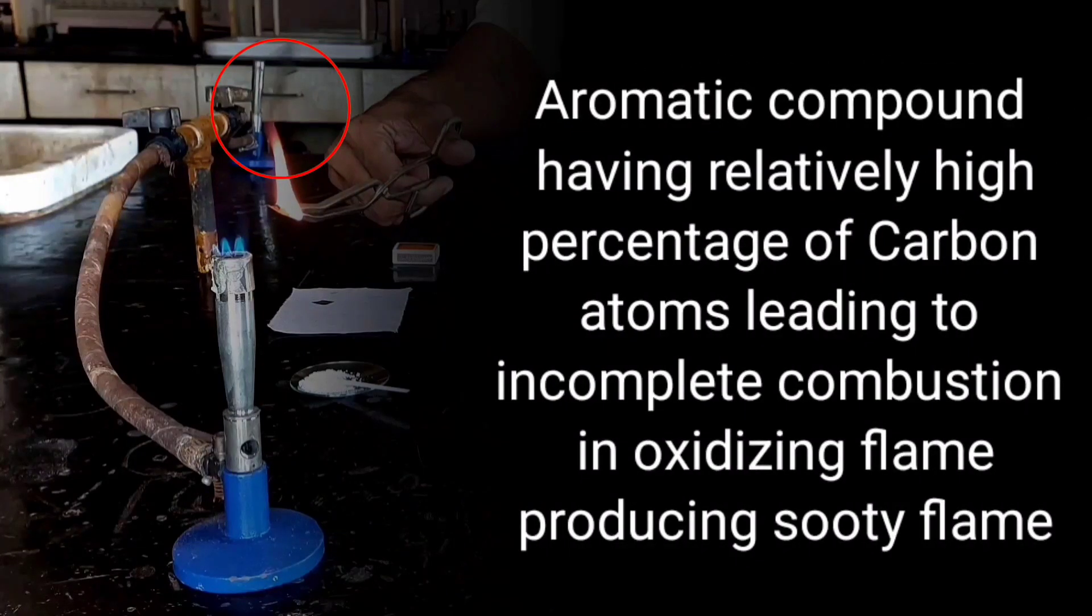Aromatic compound having relatively high percentage of carbon atoms leading to incomplete combustion in the oxidizing flame producing sooty flame.